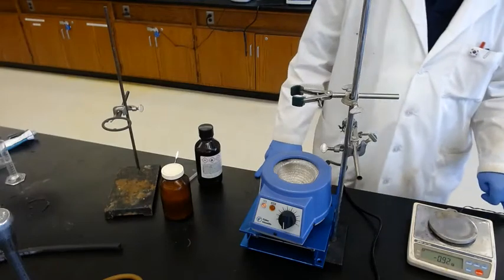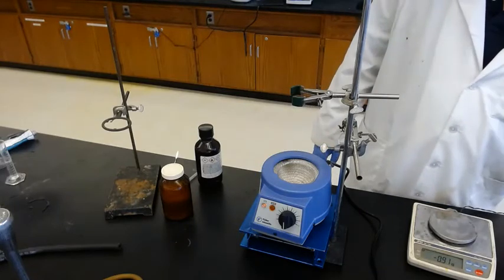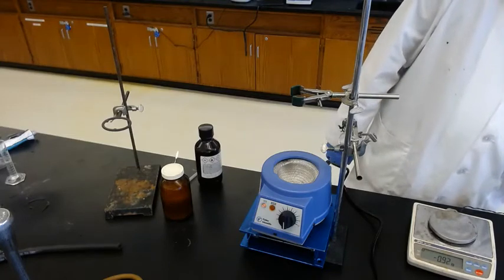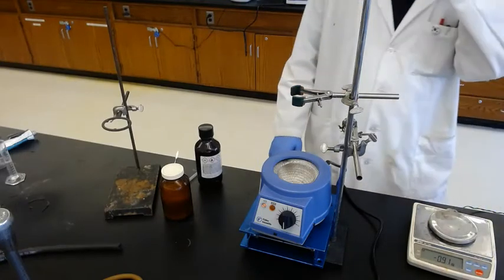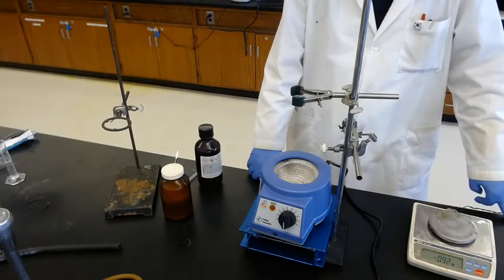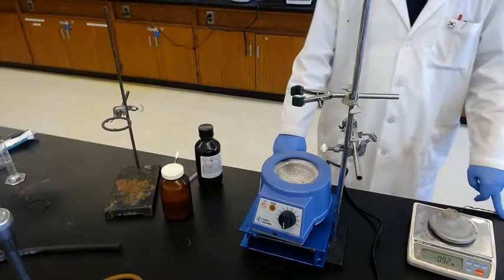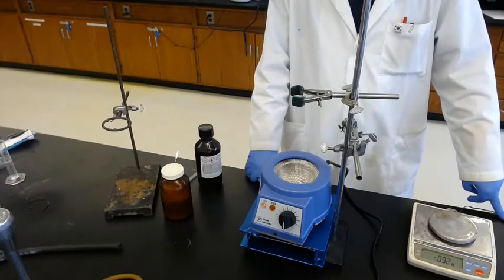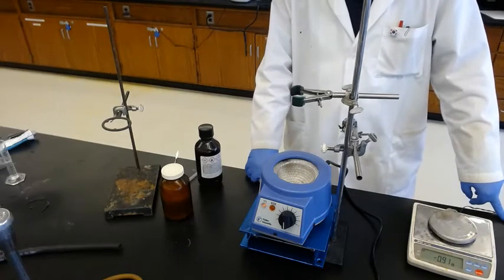Today's lab is the synthesis of N-2,4-dinitrophenylaniline compound. There are two starting compounds: 2,4-dinitrochlorobenzene and aniline. We add two equivalents of aniline because one equivalent is for the reaction and the second equivalent is to grab the hydrochloric acid which is produced. We're using two equivalents of aniline and one equivalent of 2,4-dinitrochlorobenzene to synthesize the N-2,4-dinitrophenylaniline compound.